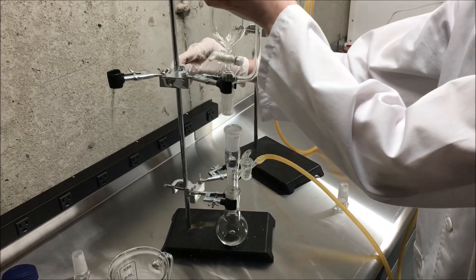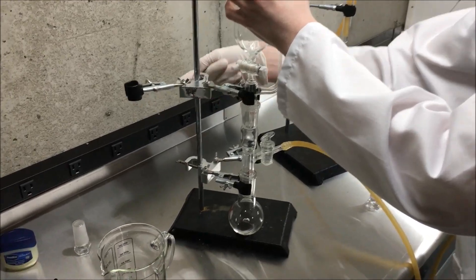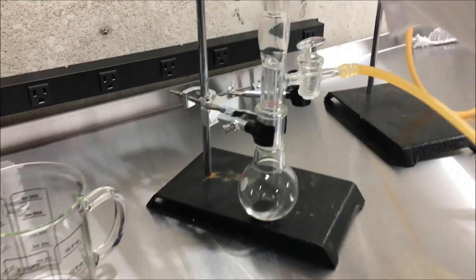This piece of glass with the hose connected to it allows liquids in, but it only allows gasses out, if they're not flowing over, of course.